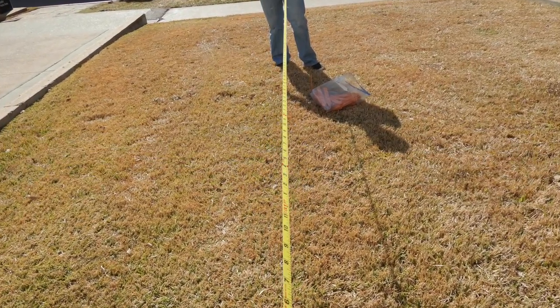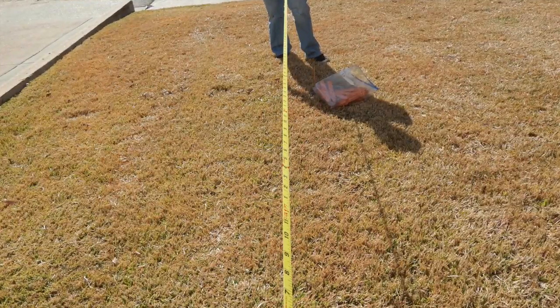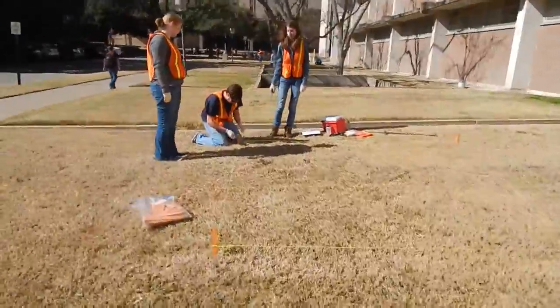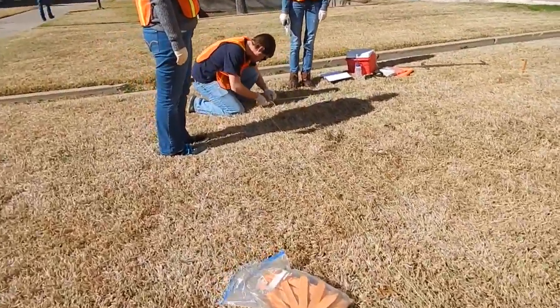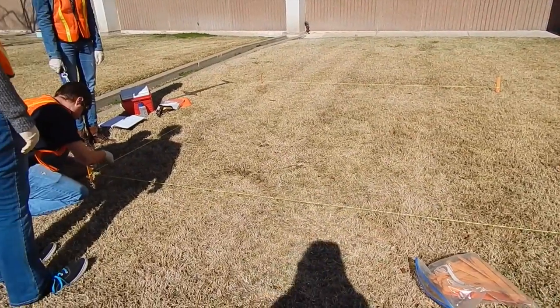To perform a standard operating procedure, first perform a general site survey prior to site entry. Specific site factors need to be included when determining the sample location, including the extent and nature of the contaminants. Once the site is established, stakes may be used to identify the sampling location.